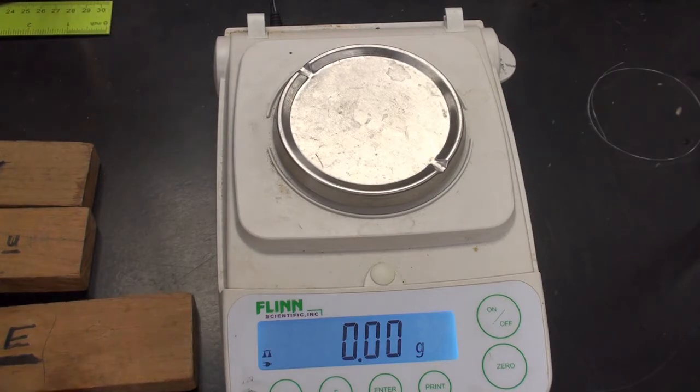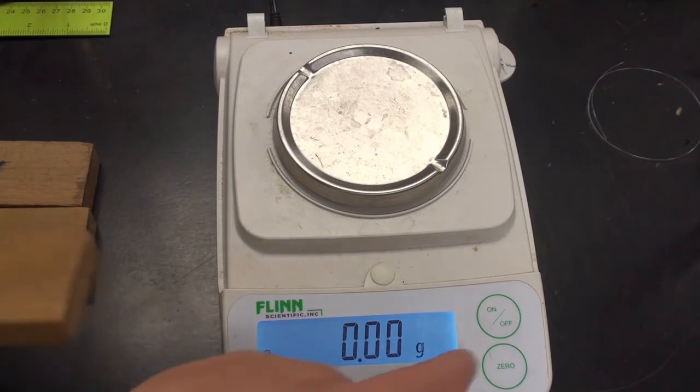And I'm just going to put them on the balance one by one. I'm not going to tell you what the mass is, but you should read the balance as I put them on, and mark down the data. Before we do this, we always zero out the balance. This balance looks pretty steady. On a regular table, you don't even want to be leaning on the table or breathing on the balance or anything. All those things can throw off your measurement. So we're going to start.